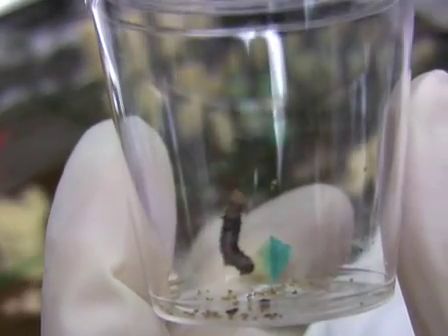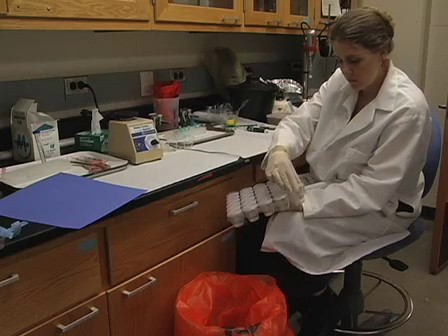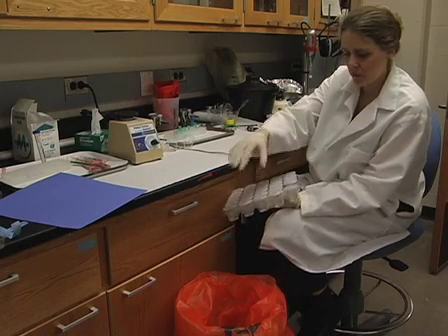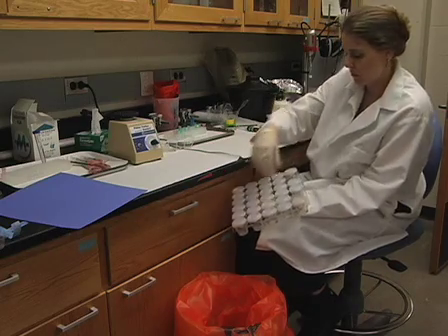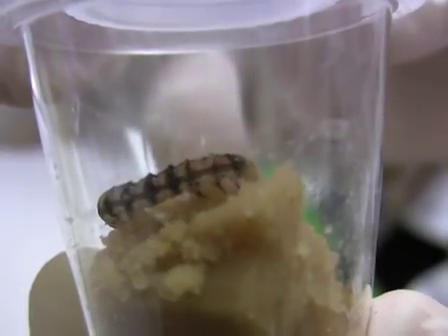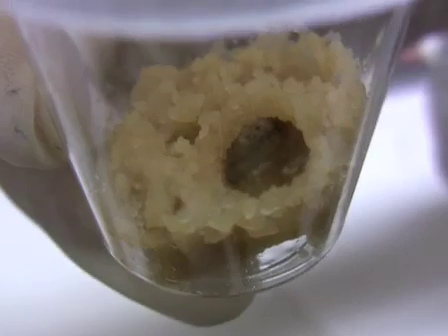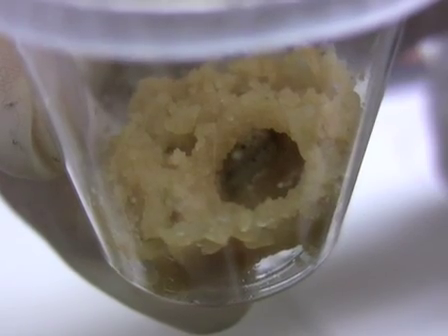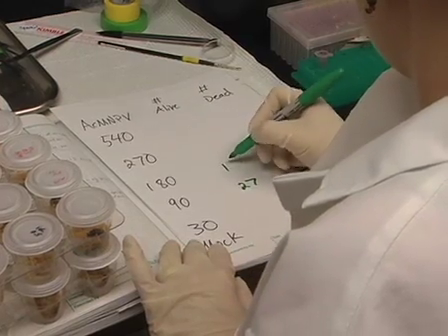Next, transfer 1 diet cube to each 4th instar larva in each cup. Then place cups in the incubator overnight at 28 degrees Celsius. The next day, discard any larvae that have not completely eaten the diet cube. Then add a large piece of diet to each cup for the remaining larvae. Maintain larvae at 28 degrees Celsius, adding additional diet as necessary until the mock-infected larvae and the surviving virus-infected larvae have pupated or begun to pupate. At this time, record the numbers of dead and surviving insects.